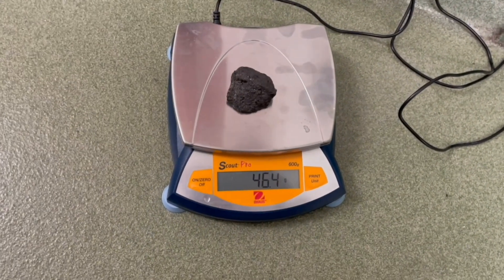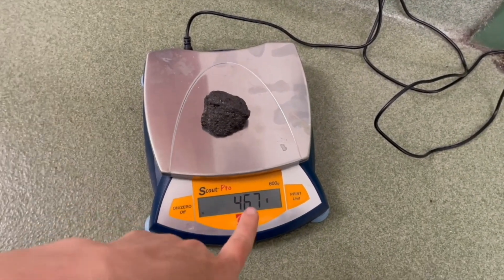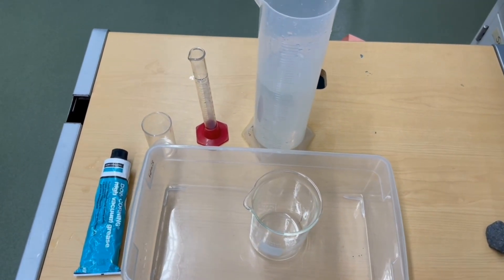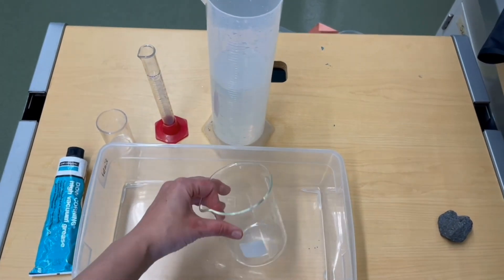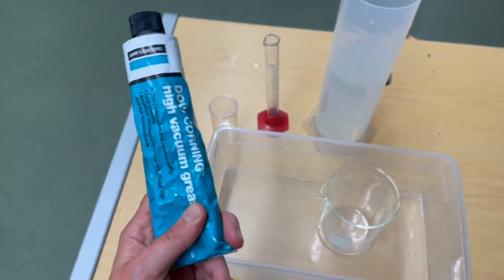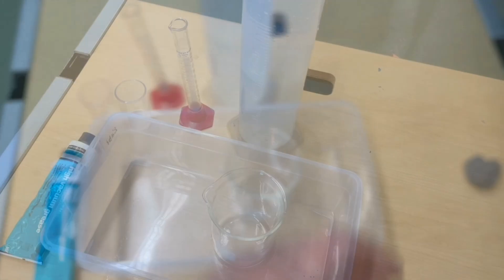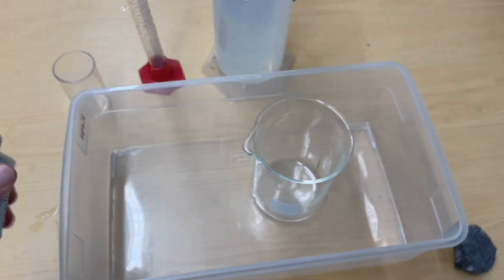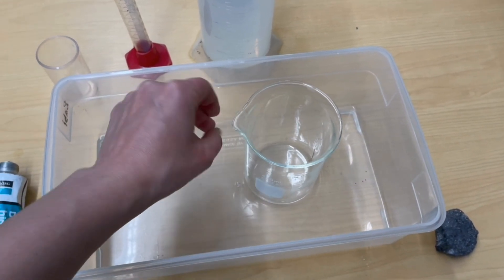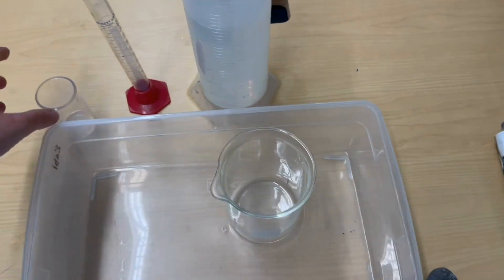If your rock is too large to fit in a graduated cylinder, you will need to measure its volume via displacement in a different way. You can create a makeshift displacement can which will allow the water to pour out. To do this, you'll need a glass beaker larger than the rock with a pour spout, a bin, some lubricant — vacuum grease or petroleum jelly both work — a smaller container, a graduated cylinder to measure it, and water. I'm going to start by putting the lubricant on the spout of the beaker, all over the inside and the outside edge. This is to prevent surface tension from trapping the water and keeping it from spilling out of the beaker.